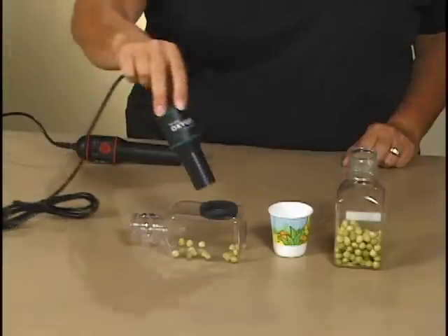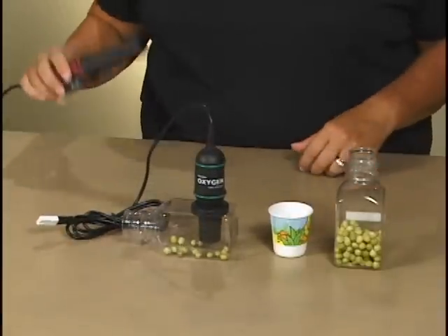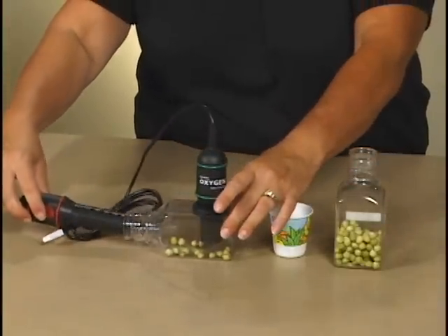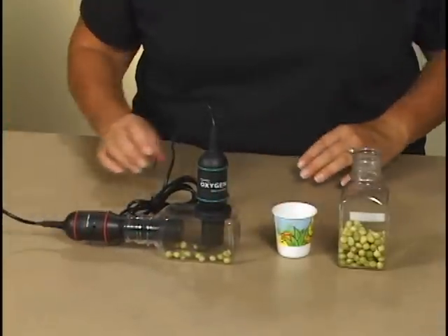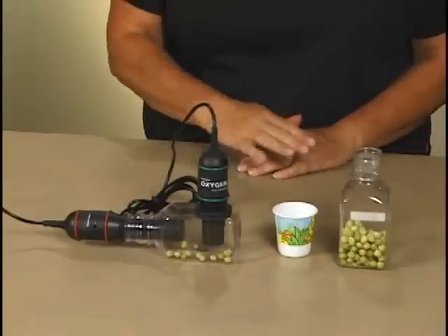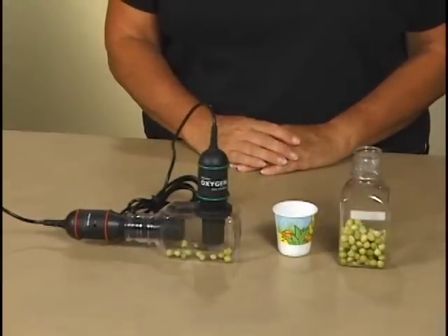I'm going to put the oxygen gas sensor into the top of the biochamber and the CO2 gas sensor into the bottom. Carbon dioxide gas is heavy and will lay down towards the bottom of the vessel. This orientation will allow you to pick up the CO2 earlier.